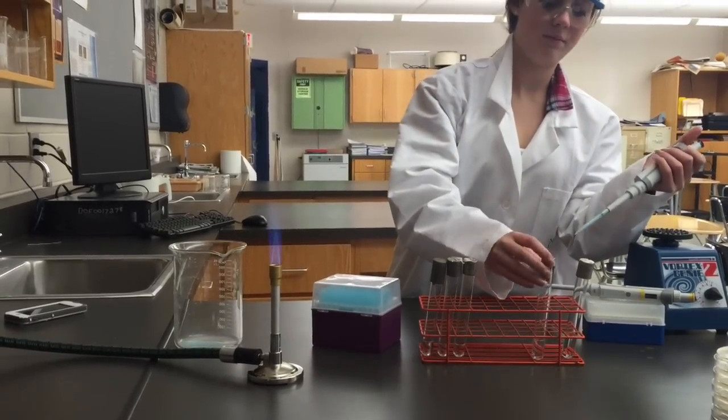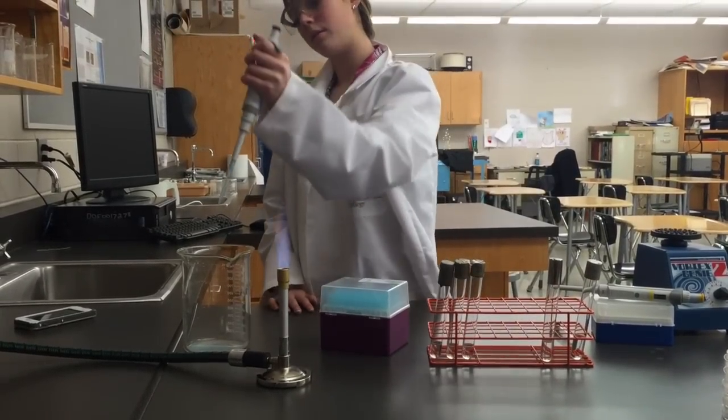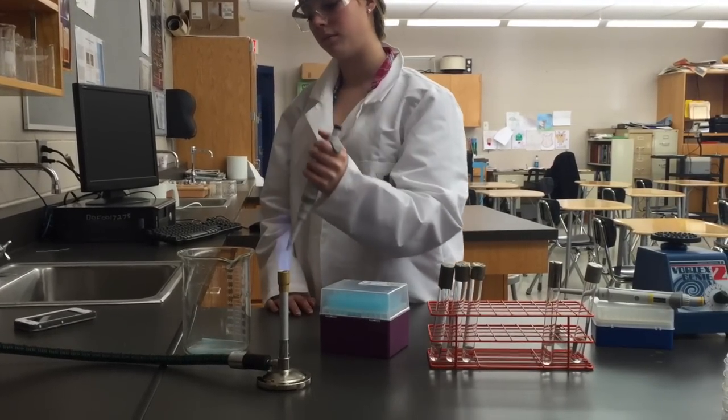Once you have finished transferring your volume, the tip that is on the end of your pipette can be ejected into the biohazards waste bin by pushing the ejection button with your thumb.